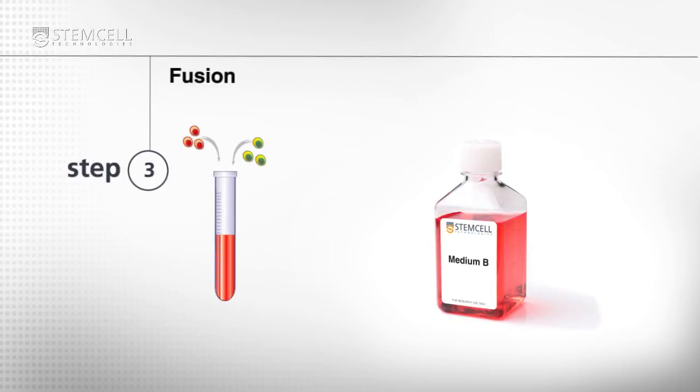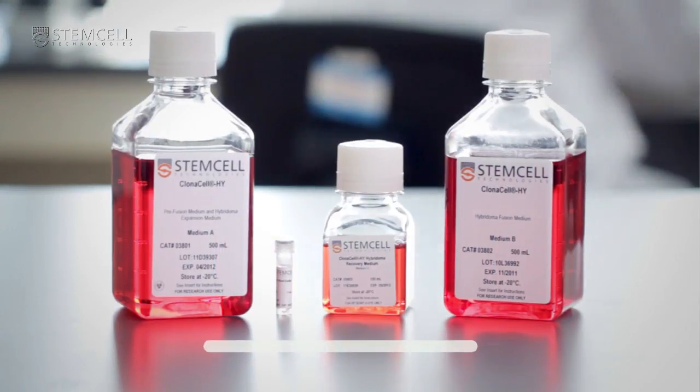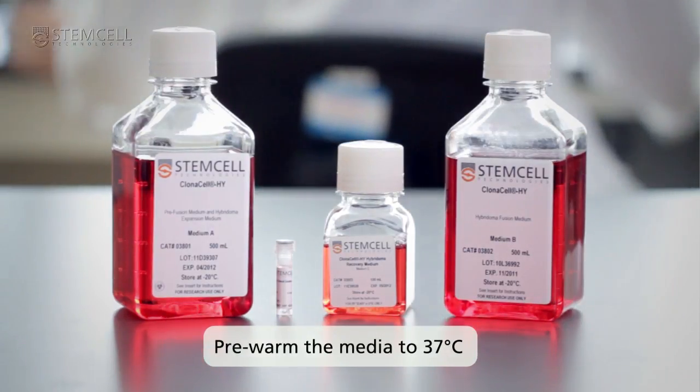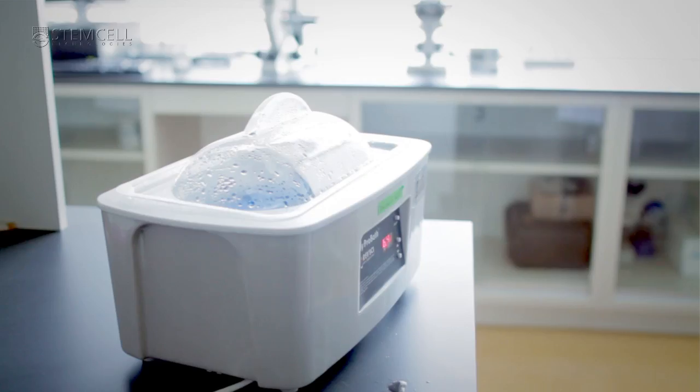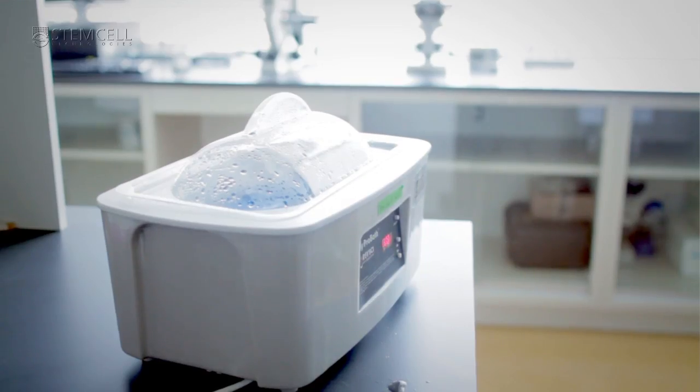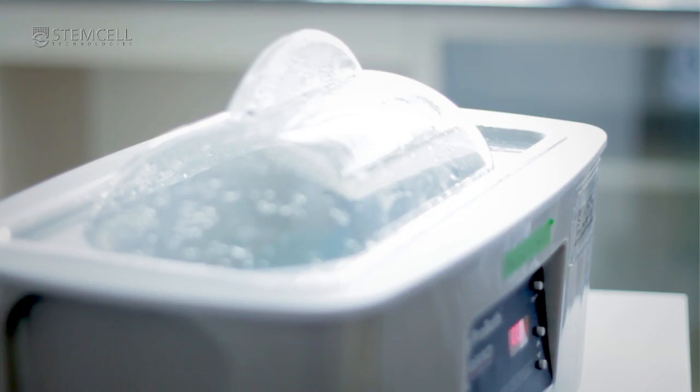For fusion, PEG and media A, B and C will be required. Pre-warm them at 37 degrees Celsius. Ensure that a 37 degrees Celsius water bath is ready for the fusion steps.